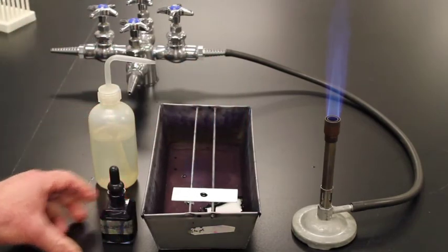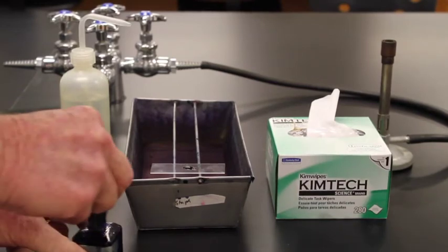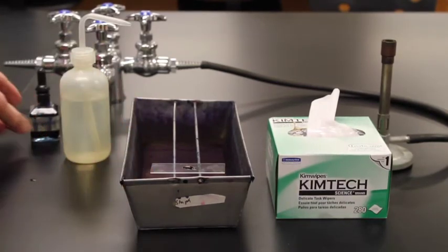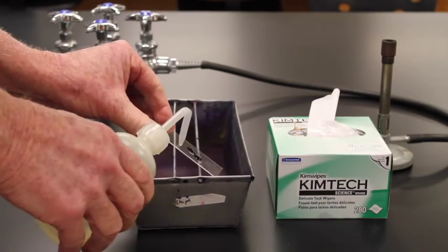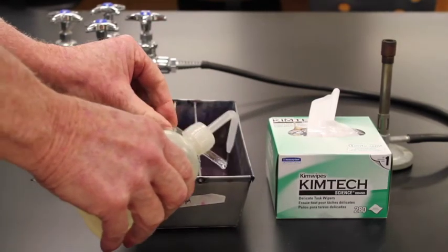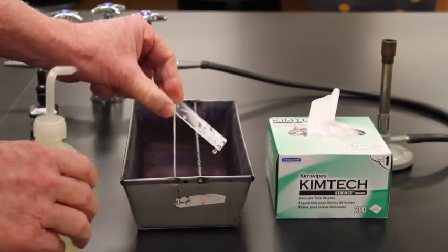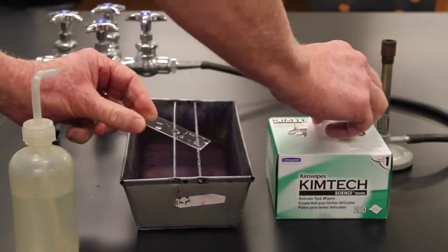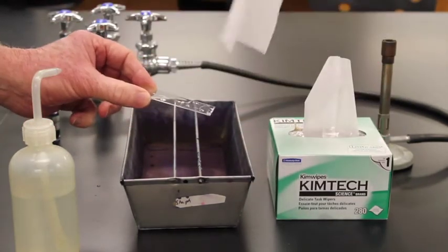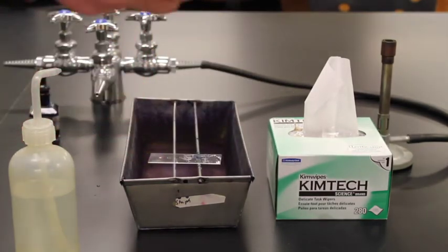We're then going to wait for a minute. And the methylene blue has been on for 1 minute, so I'm going to wash off the stain. I'll just take my wash bottle, angle my slide down, and simply wash all of that methylene blue off. By heat fixing over the heater, my cells stayed on when I washed it off. Now all I have to do to finish this off is blot it dry with Kim wipes, and then I can look at it underneath the microscope.